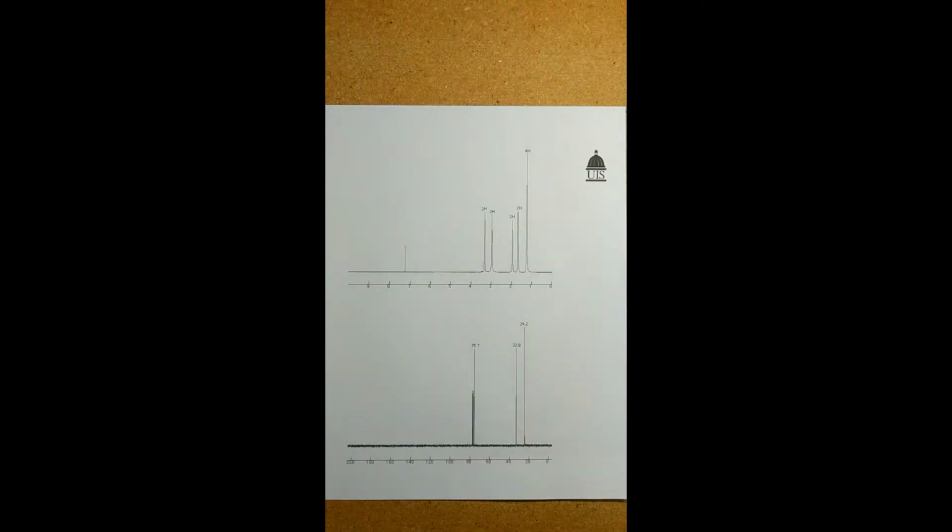Okay, now that we have taken a look at mass spec as well as IR, we're going to move on to proton NMR. This is arguably the most important step of this entire process in determining the structure of C6H12O2, because it really gives us the most information on things such as de-shielding, proton integration, symmetry, etc. So let's just dive on in here.